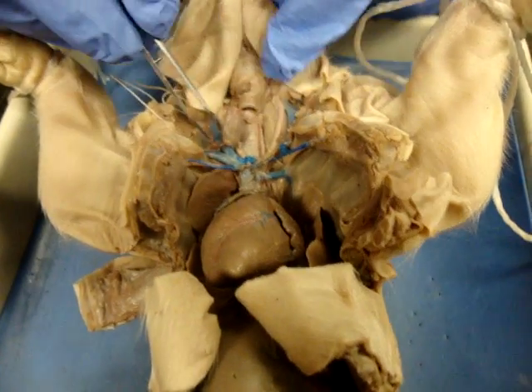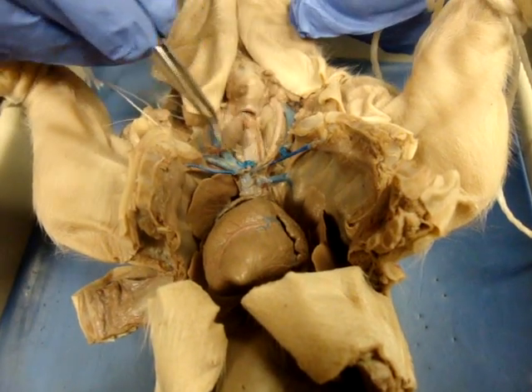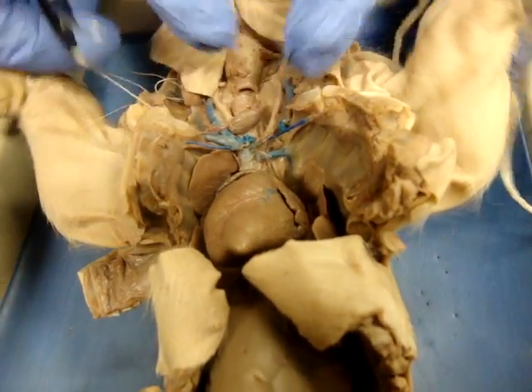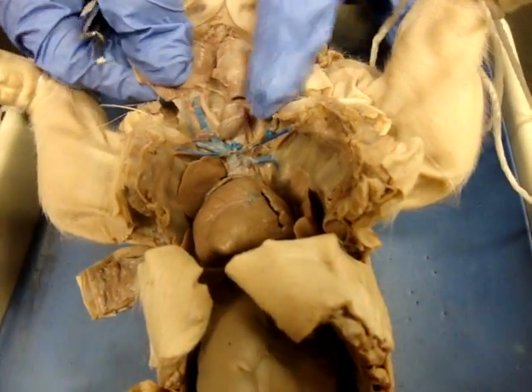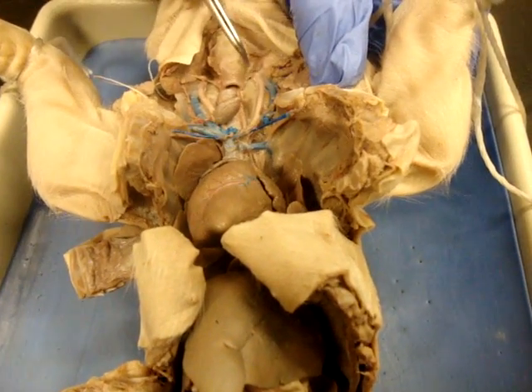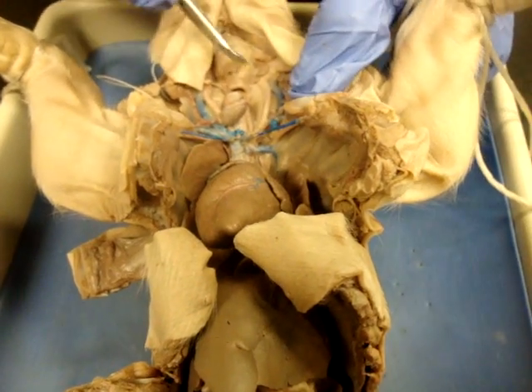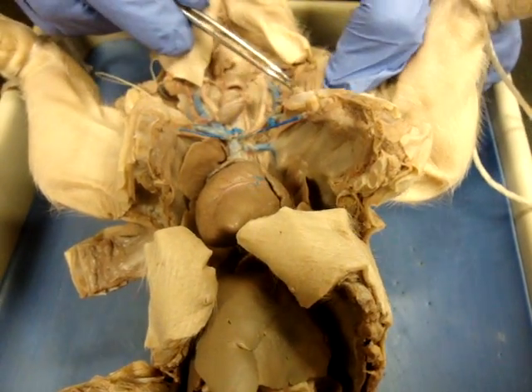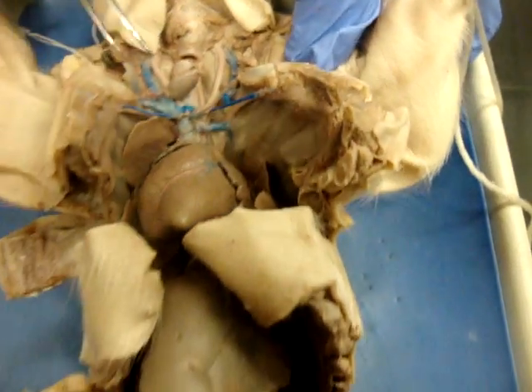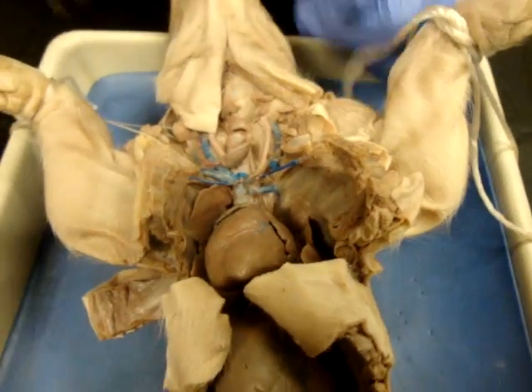The thyroid gland is found right on top of your trachea. Here's our thyroid gland — it had been pushed off to the side for the dissection, but it's right here. You should be able to see your thymus gland normally up in this region, but it's been a little bit obliterated by the dissection process. There's a little bit left up in here. The key thing you're looking for with the thymus gland is that it comes up on either side and has kind of a mottled appearance to it.